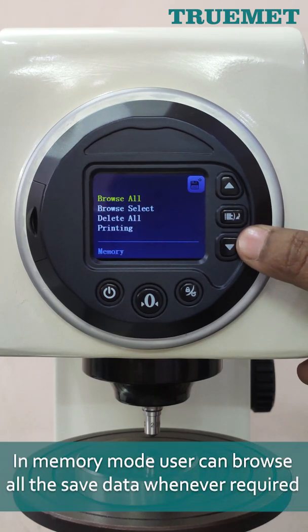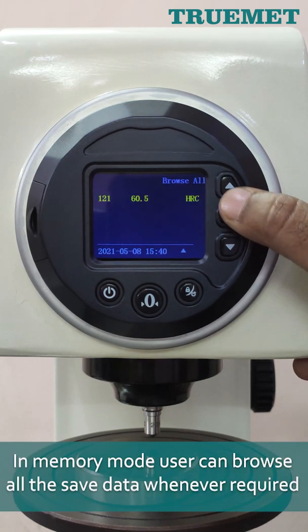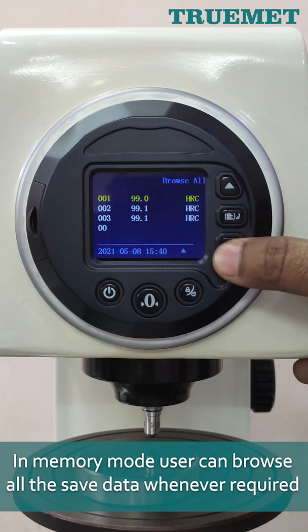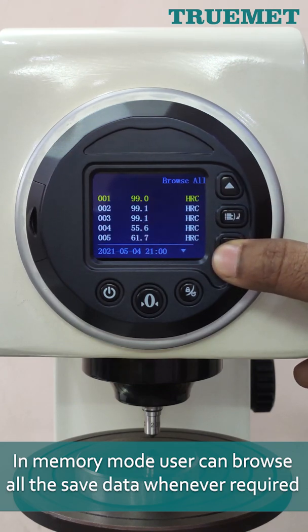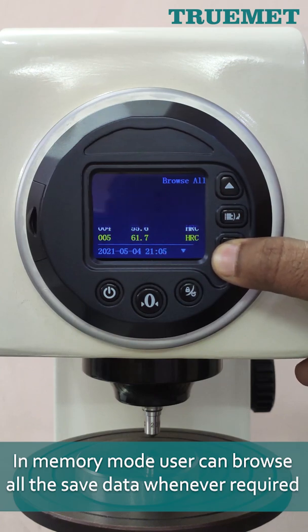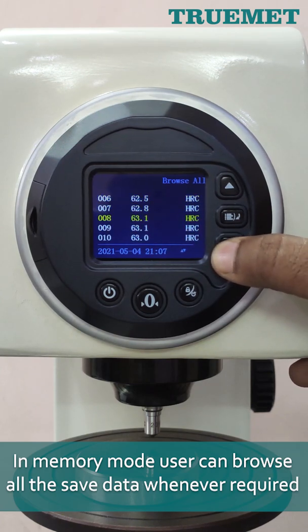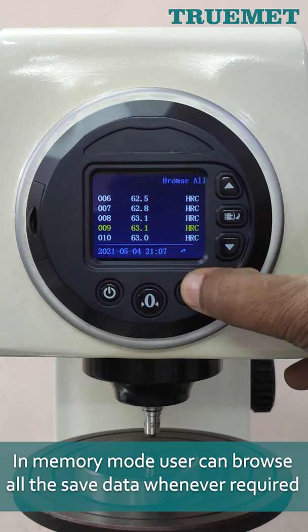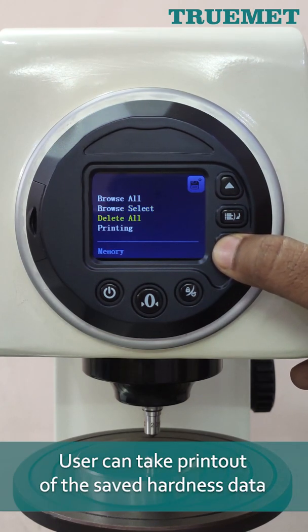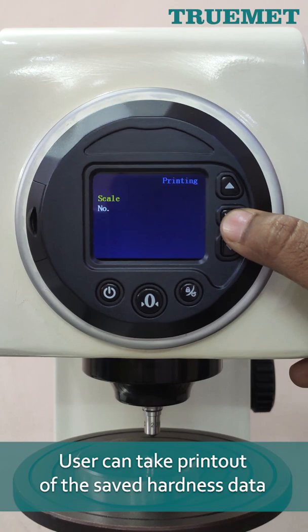In memory mode, user can browse all the saved data whenever required. User can also take a printout of the saved hardness data.